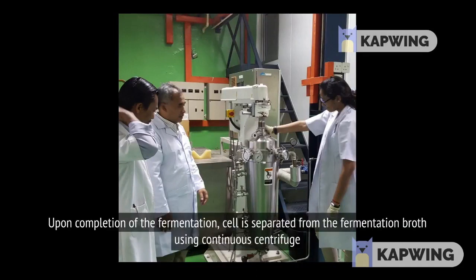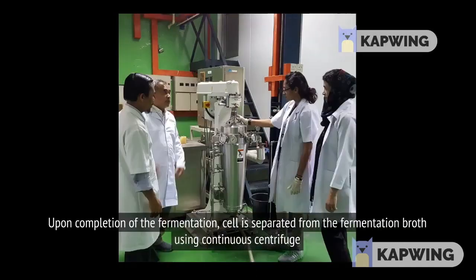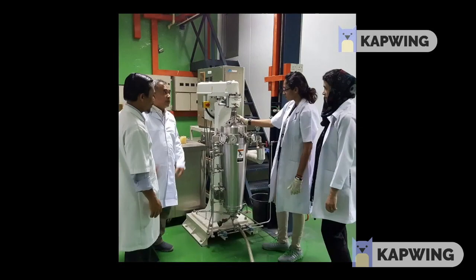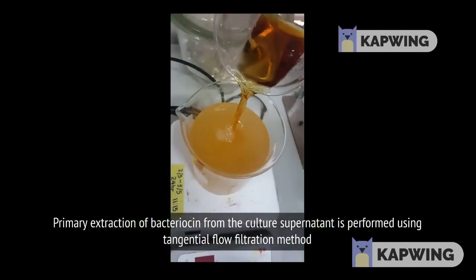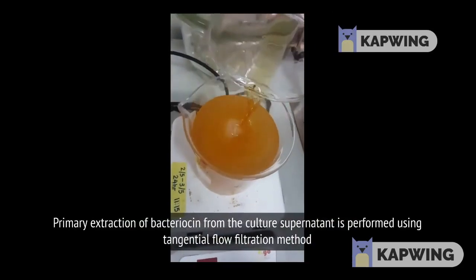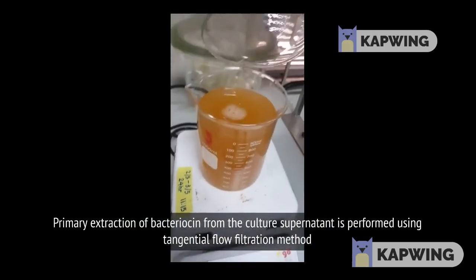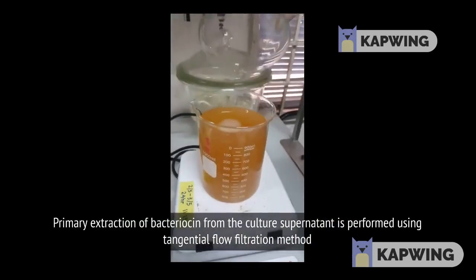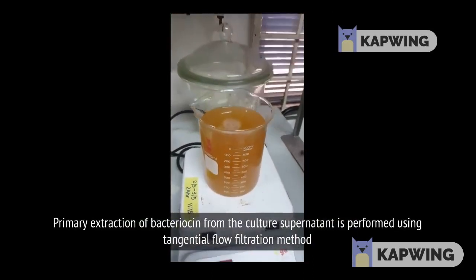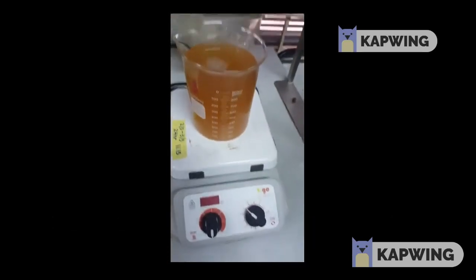Upon completion of the fermentation, cells are separated from the fermentation broth using a continuous centrifuge. Primary extraction of bacteriocin from the culture supernatant is then performed using the tangential flow filtration method.